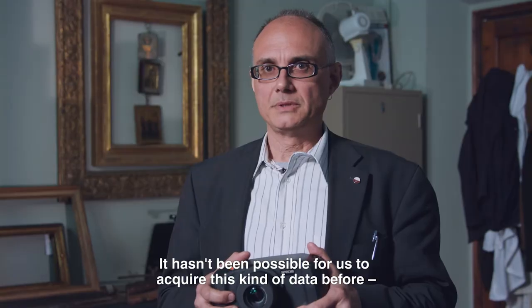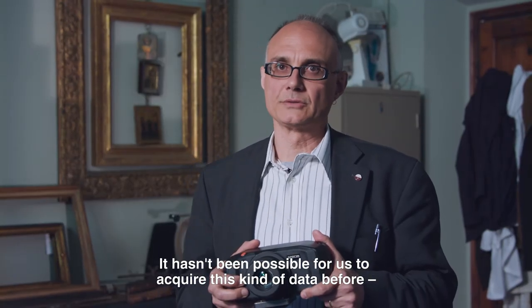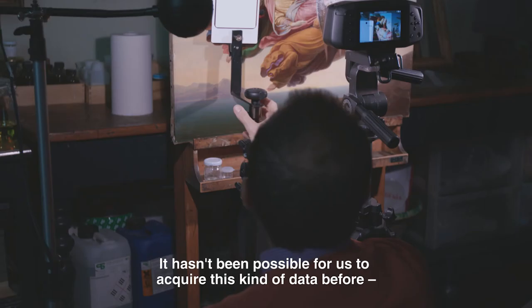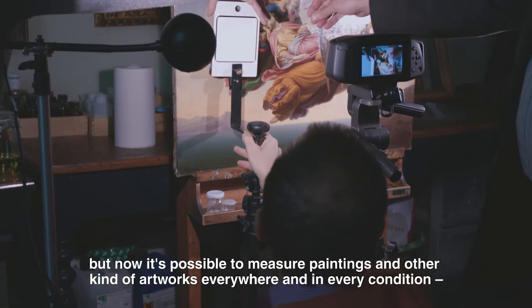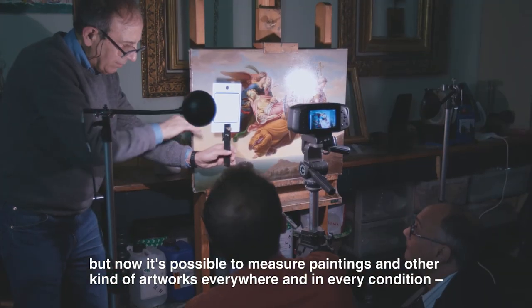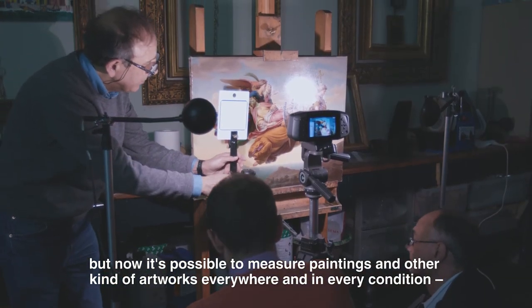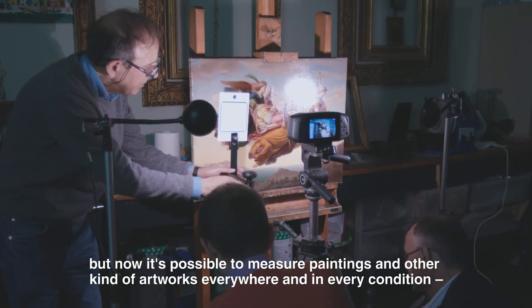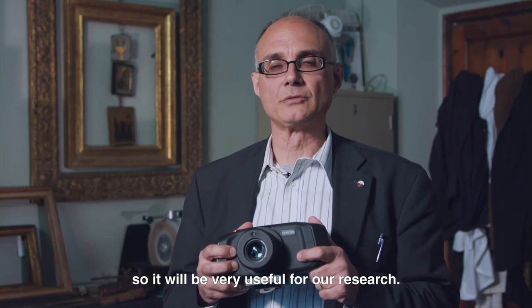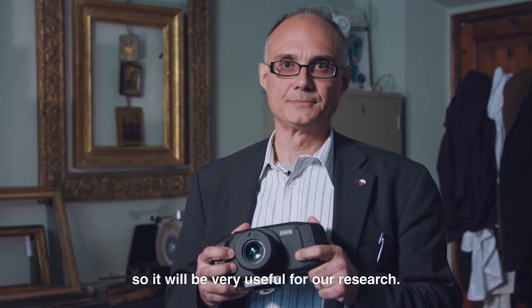It wasn't been possible for us to acquire this kind of data before, but now it's possible to measure paintings or other kinds of artworks everywhere and in every condition, so it will be very useful for our research.